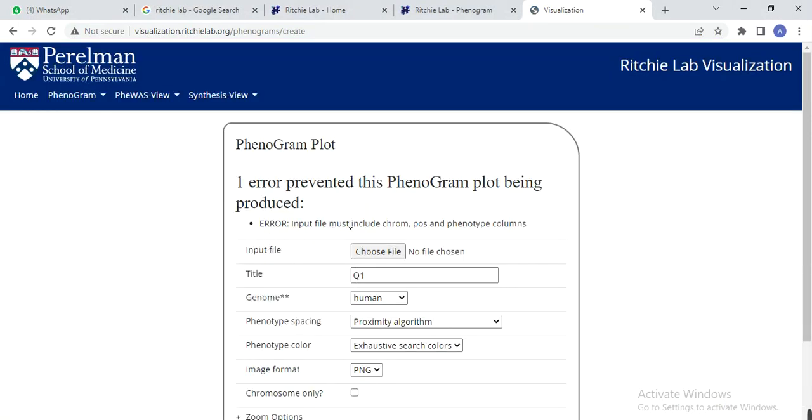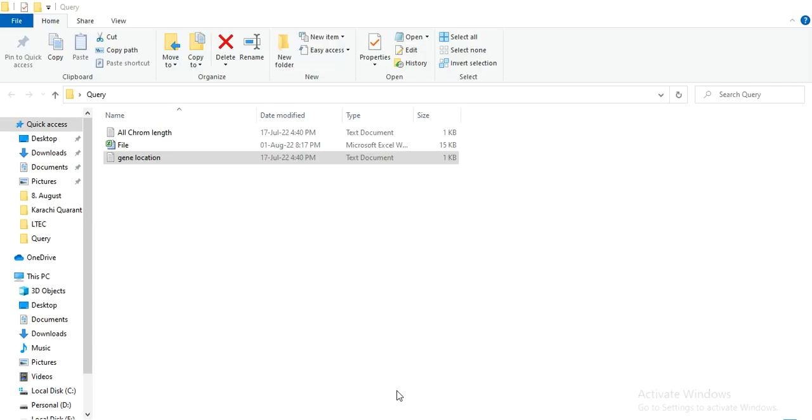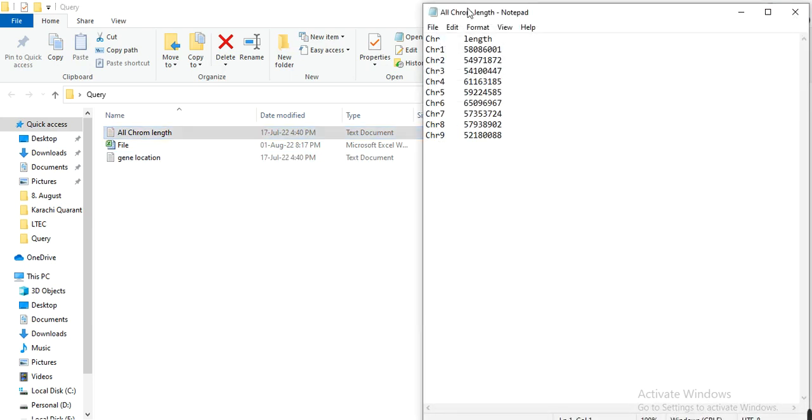It gives the error: input file must include chrom pos. So let's check the file. There are other reasons, but the main reason is that we have a space between two columns, which must not be included. Here you can see this is the space, 1, 2, 3, 4, 5. A space button is pressed between these two columns, so there we need to remove it. There should only be one tab between these two columns, one tab, not the space.